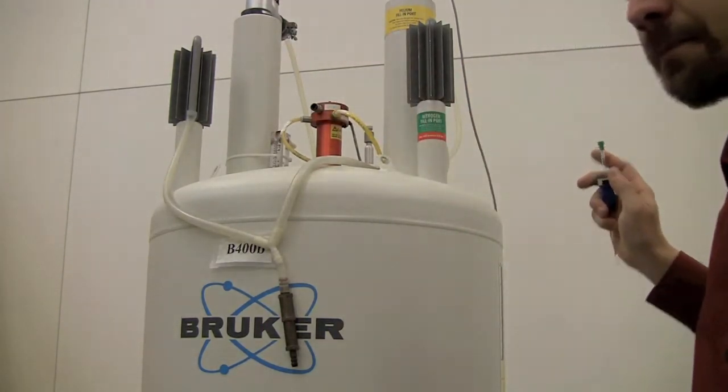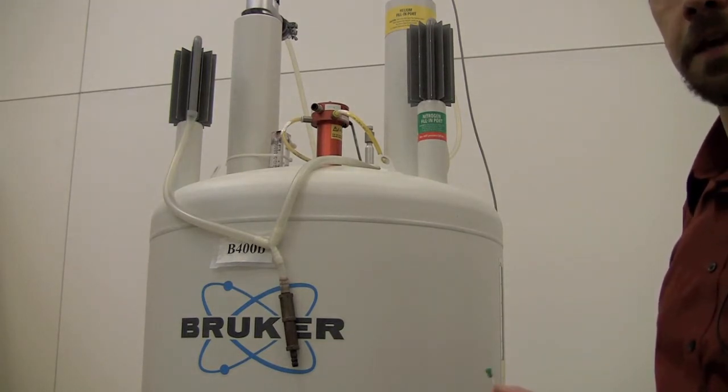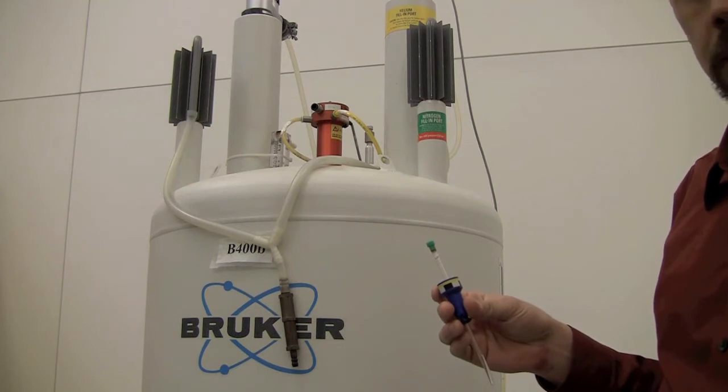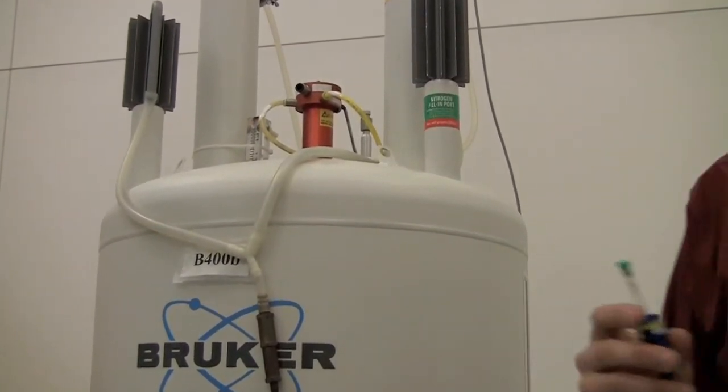If nothing popped up, the best course of action is to contact Instrument Center staff, and if you can't find them, leave a note on the report a problem link on the website. The dummy sample is just a tube of D2O, it's just a placeholder, and we're going to trade it out with our sample. So we'll go back over here, get our sample.